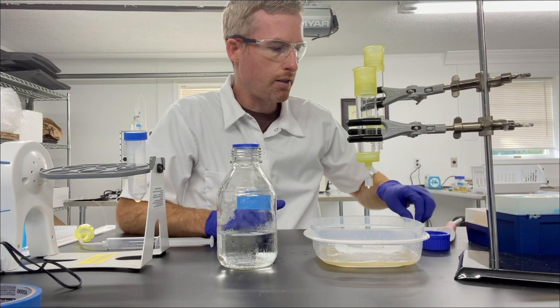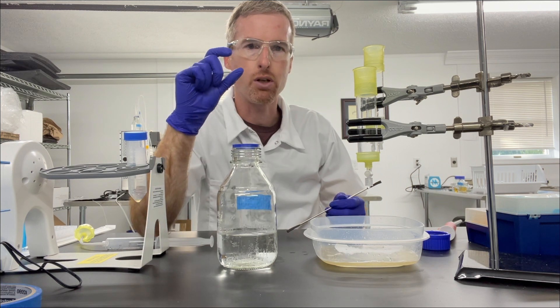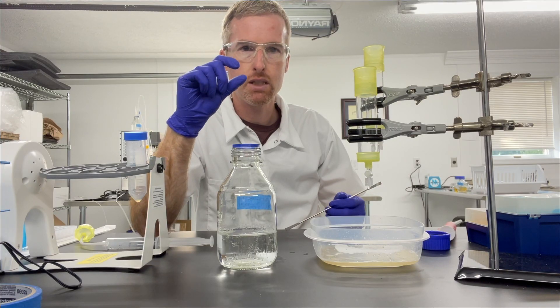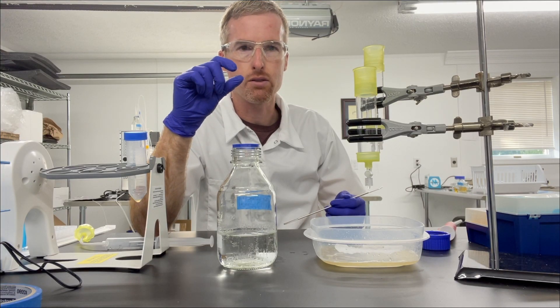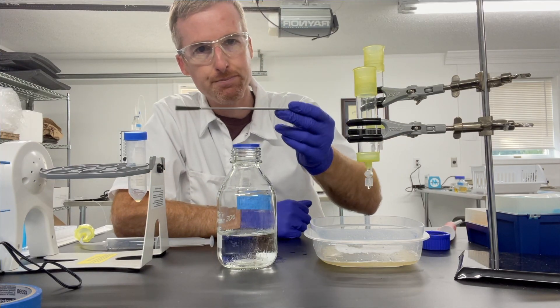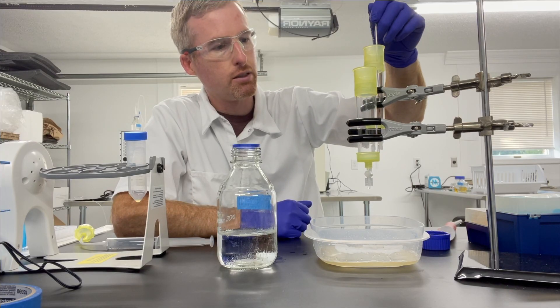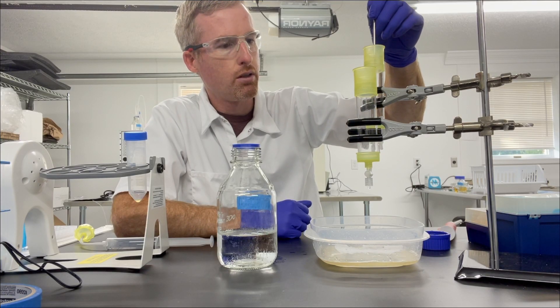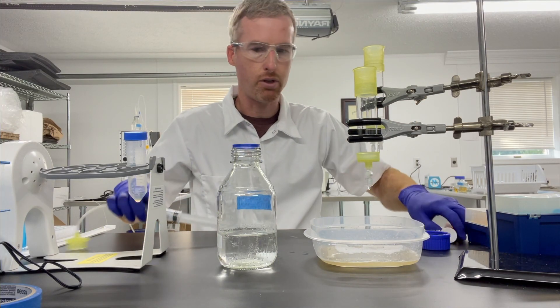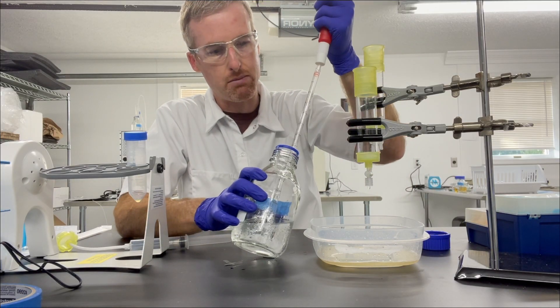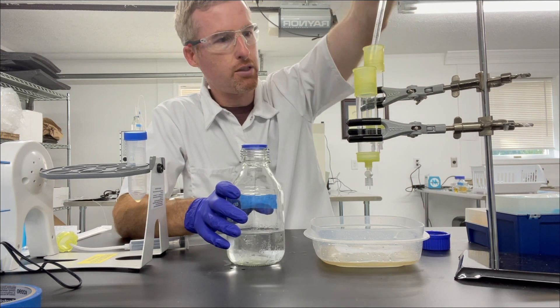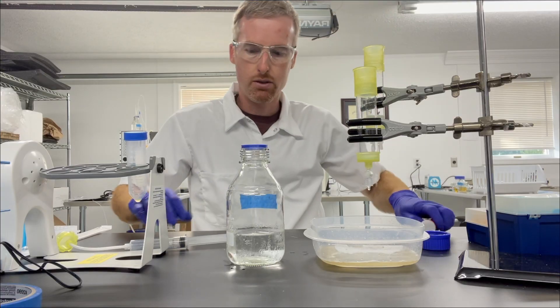Most people are good at washing their nickel agarose, but they don't realize that sometimes there can be large particles of DNA or cell debris or stuff mixed in with your nickel agarose that are not going to wash through no matter what you do. So what I like to do is take a spatula, reach in, and physically stir up the nickel agarose so that those pieces can be broken up and go through the filter at the bottom of the column. And I repeat that physical break-up step about 3 times during my 10 washes.